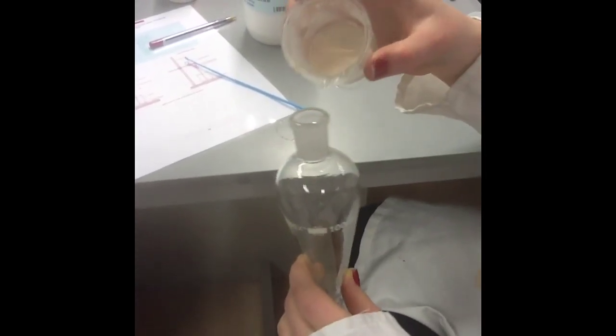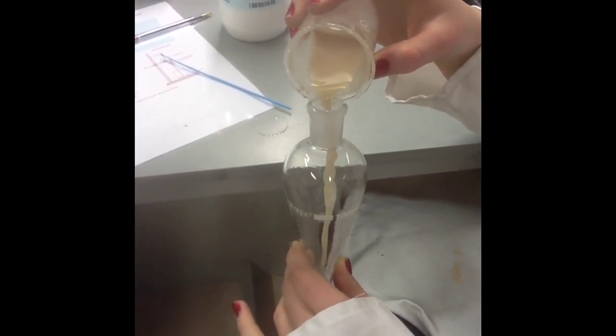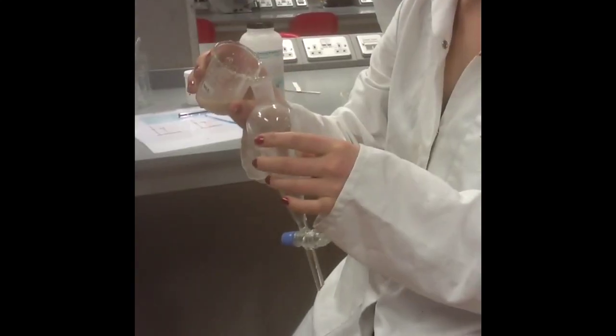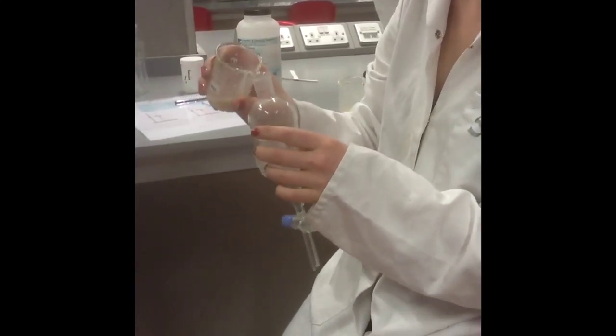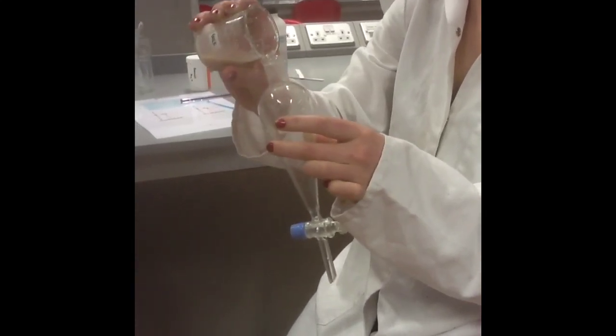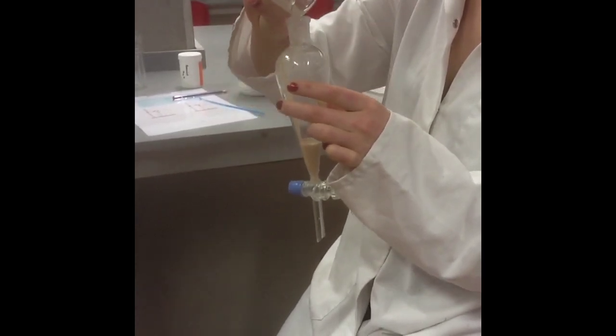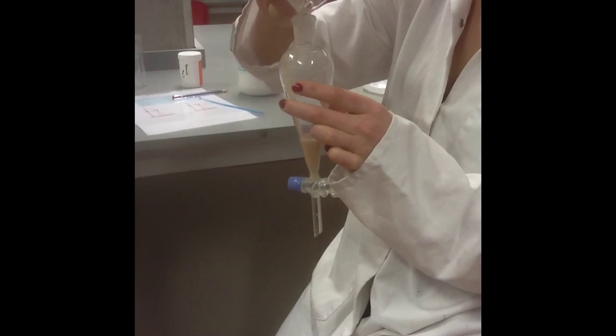Adding the yeast to the separating funnel may seem like an easy job, but be careful because often it's a lot more difficult than it looks. Okay kids, quiet down. It can happen to anyone. Let's give our lab attendant another turn. Excellent job. I think she deserves a round of applause.